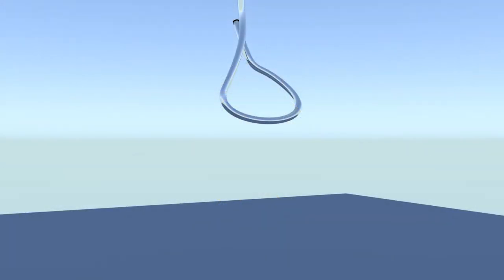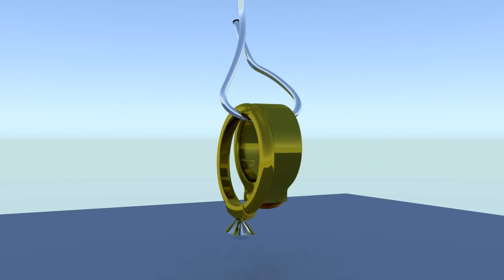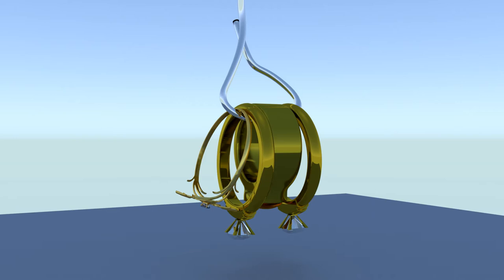To refine rings and remove the stones, we will string them on a wire so that we can make electrical contact. The wire should be 8 gauge or thicker. It should be either silver or titanium. Those areas of the wire that are not in contact with the rings should be coated with either silicone sealant or heat shrink tubing. Leaving wire exposed will acidify the solution, causing a chlorine or bleach type odor. So it's preferable to coat the wire.